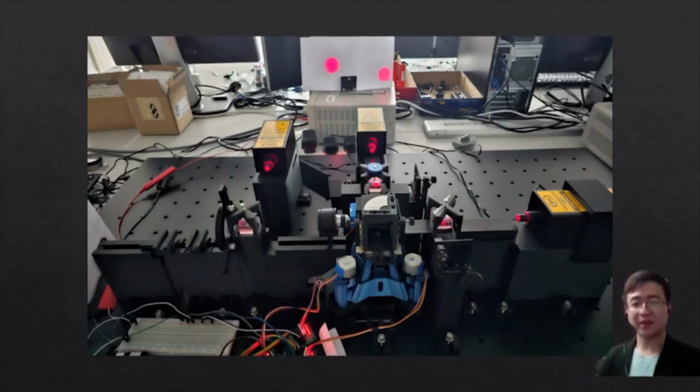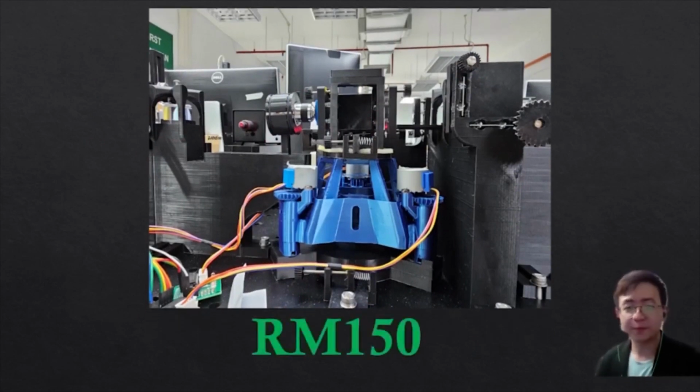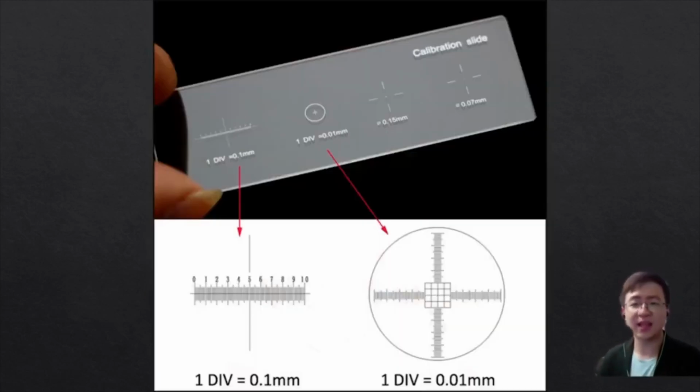So let's get started. The stage that we utilize today is the open source OpenFlexure delta stage. The cost of manufacturing one is at 150 ringgit or even lesser. It is affordable, it is portable, but for its reliability, there is not much research done for the measurement in nanoscale. When we're using this in microscope alone, a calibration slide can be sufficient enough to quickly do the calibration.